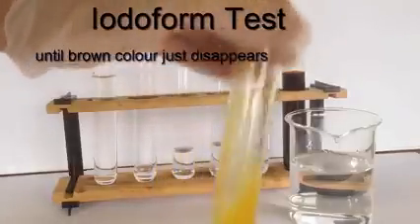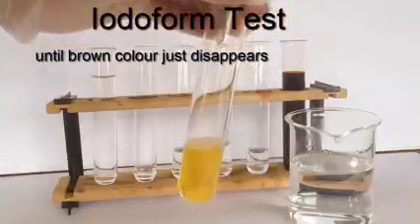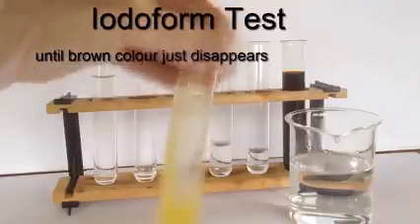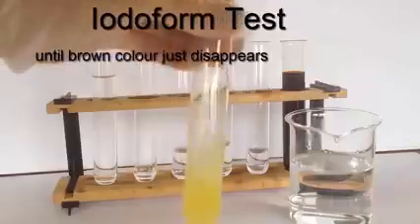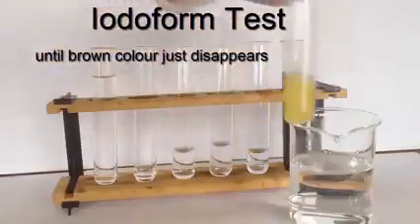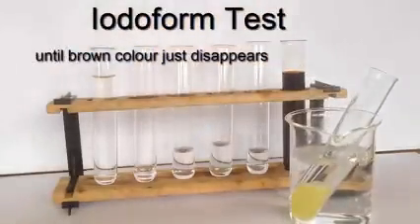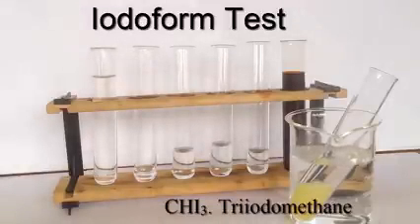So the brown color is fading as I continue to add the sodium hydroxide. So we're looking for one of 2 results. It is either going to go colorless and clear, or it's going to jump over to a yellow color and go cloudy as a fine yellow precipitate forms. And you can see what we've got here is a fine yellow precipitate.